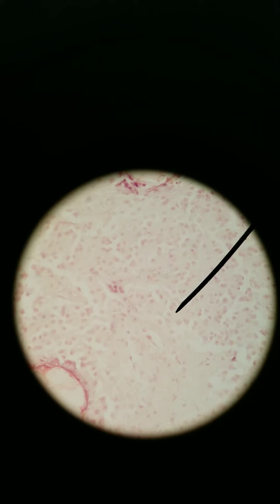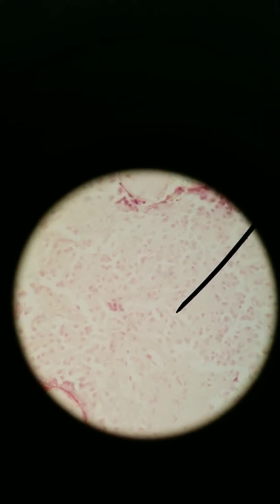Most of the cells you see are either pinealocytes, which are the cells of the pineal gland, or they're glial cells. That's not the distinguishable thing to help you identify what the pineal gland is.